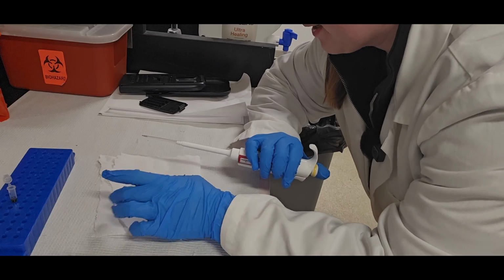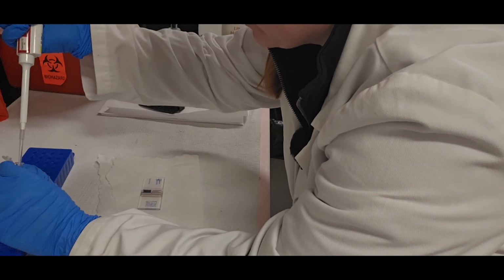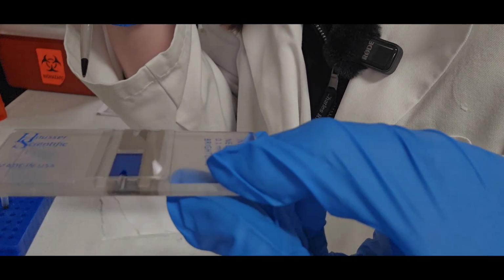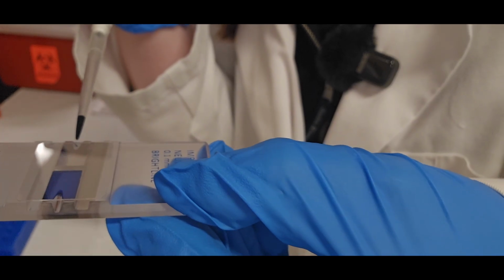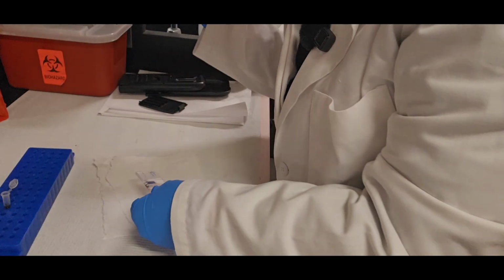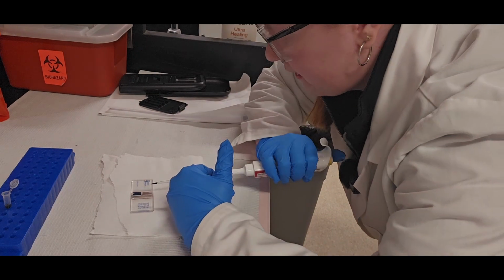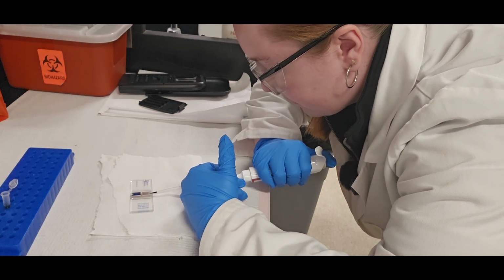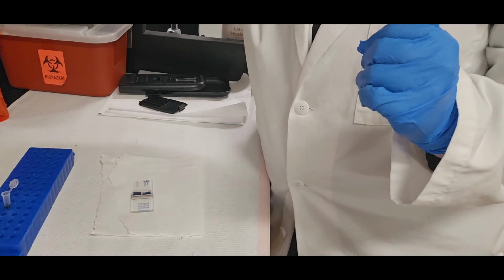When I'm doing this, I'm not touching the hemocytometer at all, but the tip is inside the channel. So let me see if I can actually show this. I'm placing the tip in there, but I'm not moving the slide or touching down. So that's why you might need to use a pinky if you're extra shaky like me.